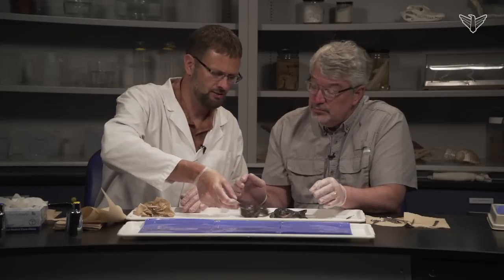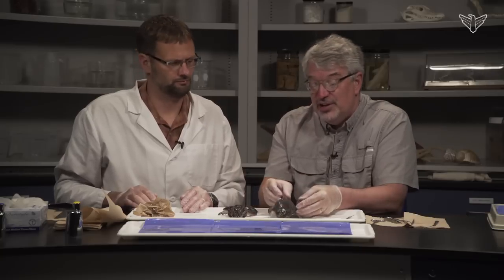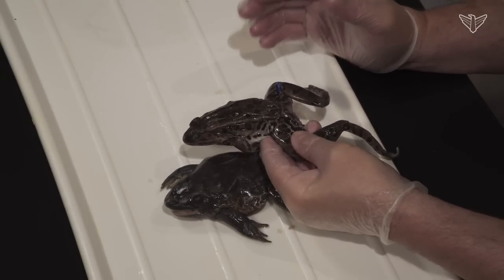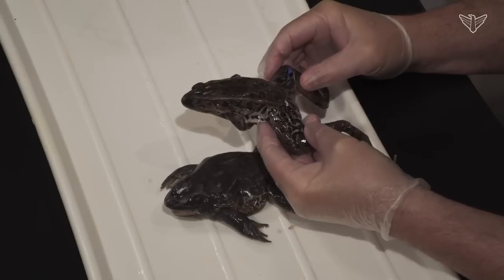Another choice you have when you get your frogs is whether they're plain un-injected frogs, just with preservatives, or whether the circulatory system has been injected with a latex that colors the arteries and veins. They use red for the arteries and blue for the veins. If you really want to look at the circulatory system in detail, then these injected frogs — which cost more — are useful. We'll probably dissect a regular one and then show an example of an injected one.